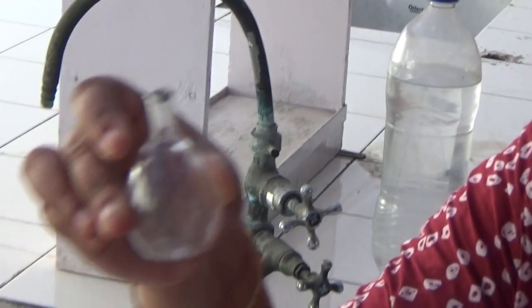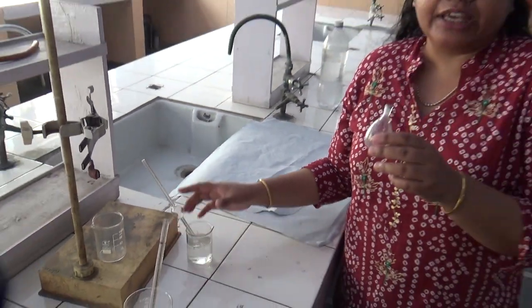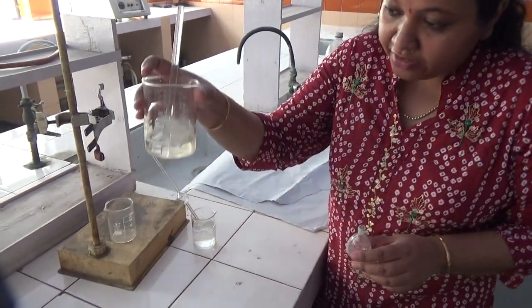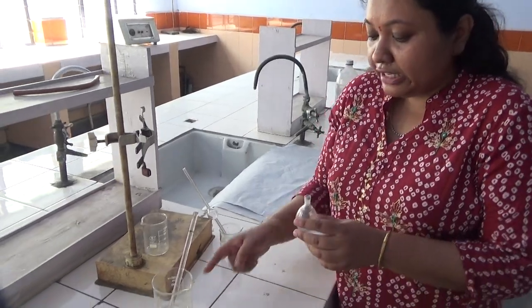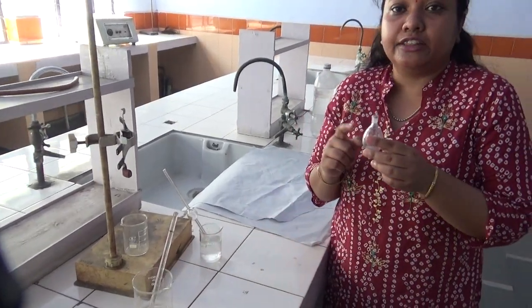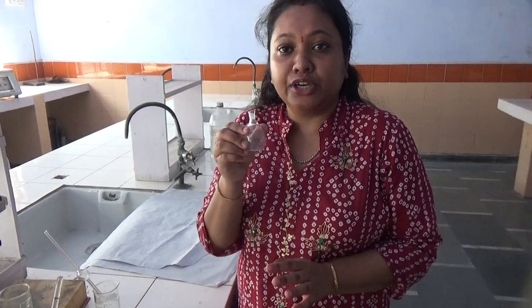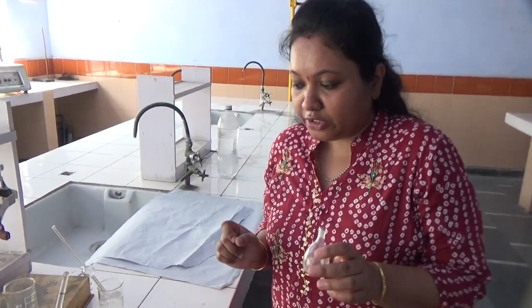First, you have to take the empty weight of the RD bottle. Next, you will be filling it with distilled water and again you will be weighing it. Next, you will be filling it with the surfactant — an unknown sample of the surfactant will be given. With this, you have to take the weight. So, from the weight of all these three, you have to find out the density of the surfactant and the water.